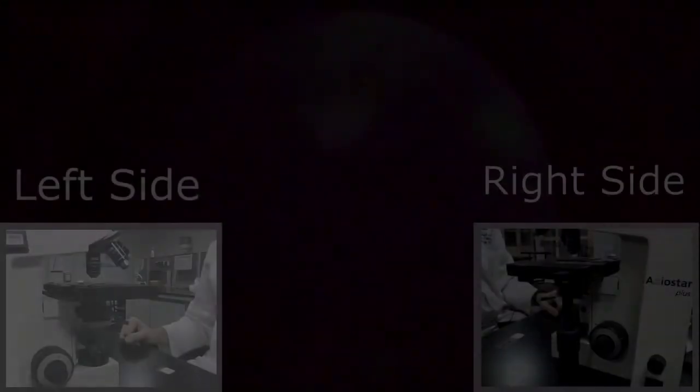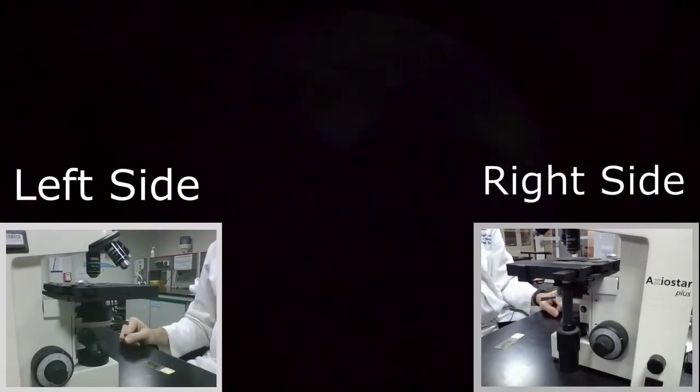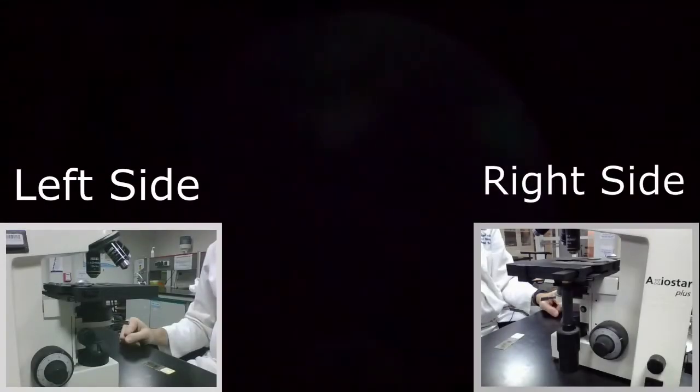Hi everyone. In this video we're going to be looking at how we focus a slide under a compound light microscope. So let's talk about focusing a slide.